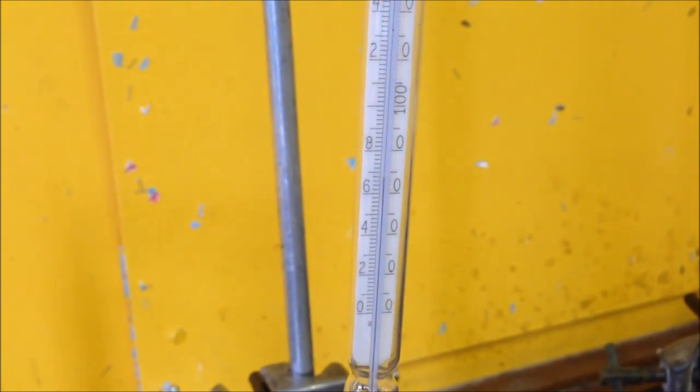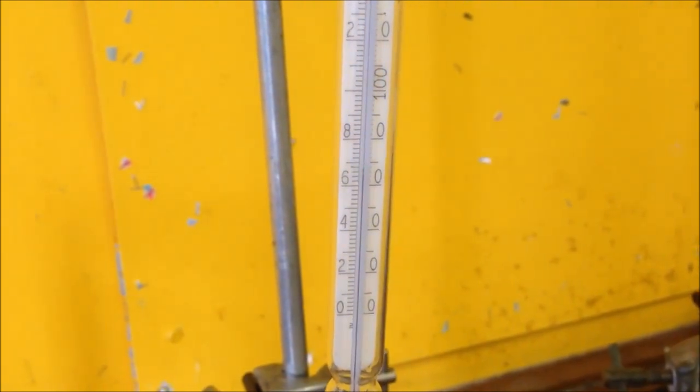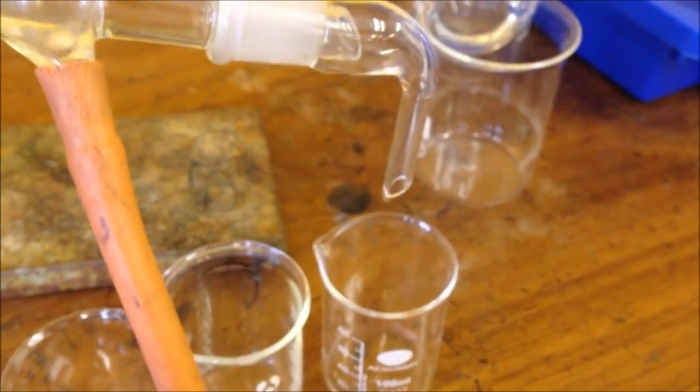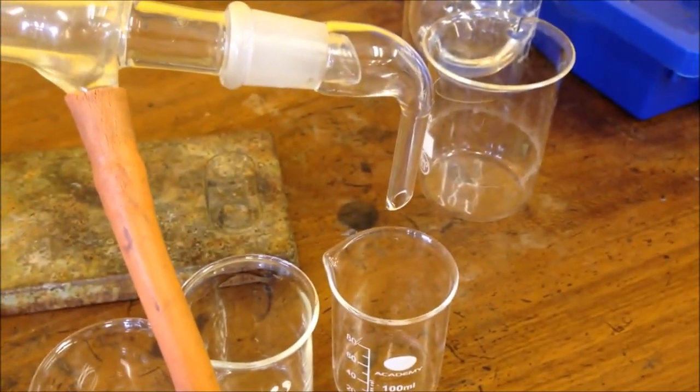We are waiting for something to distill off between 74 and 79 degrees. So everything that is coming out at the moment we can just discard.